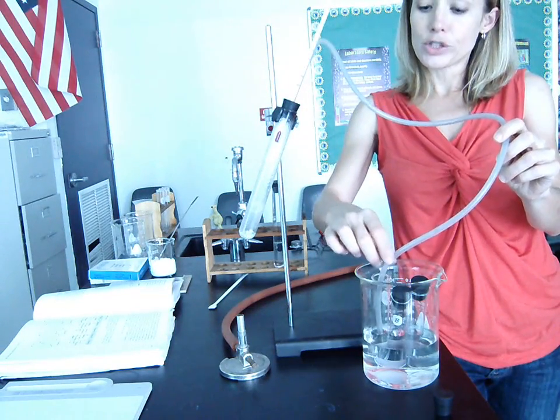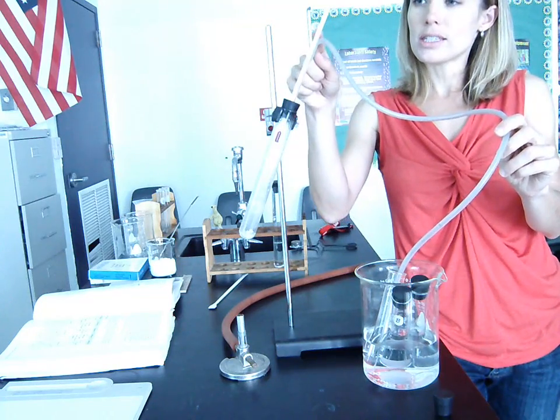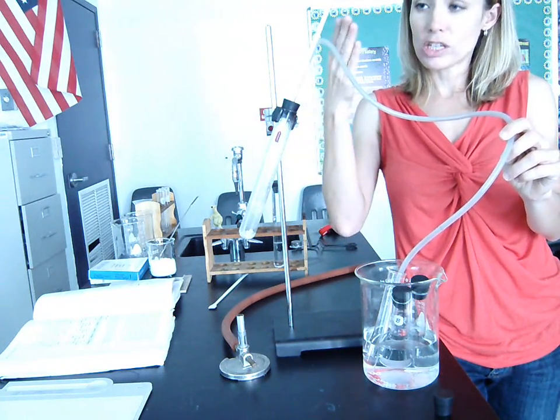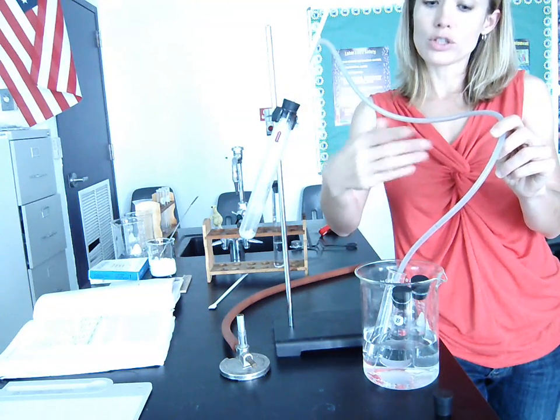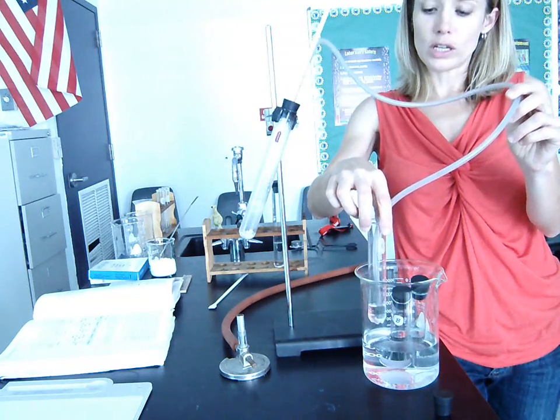So we leave the delivery tube here in test tube A for as long as the temperature stays at 80 degrees. Again, we heat it up, we watch the temperature increase. At 80 degrees, we'll notice that it starts to boil, the gases travel through the delivery tube and cool down, and then condense and are collected in this test tube over here, okay?